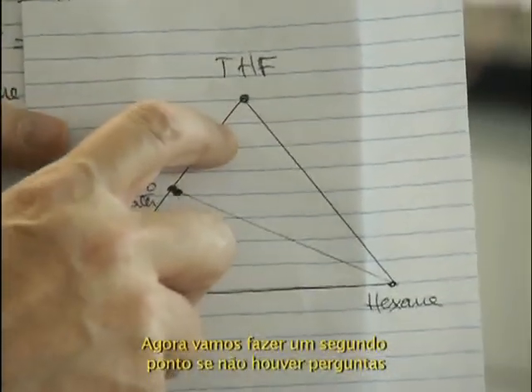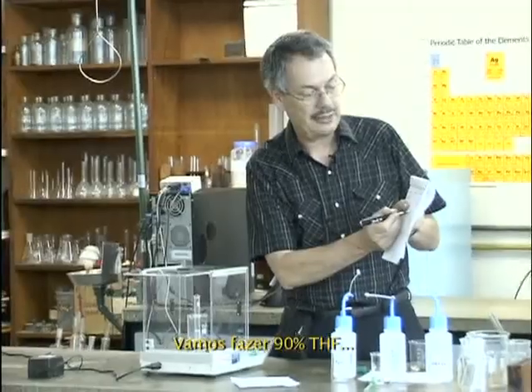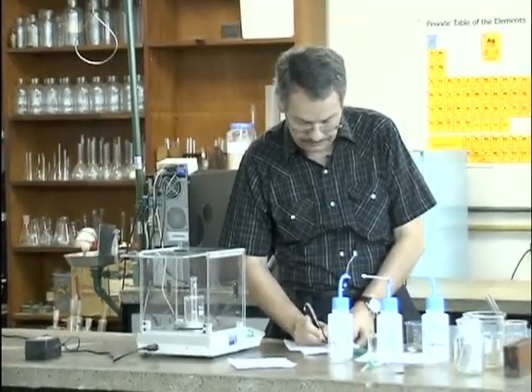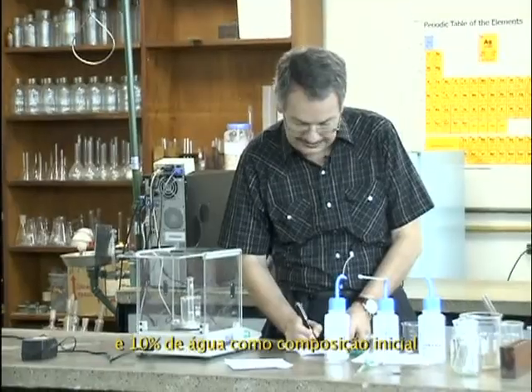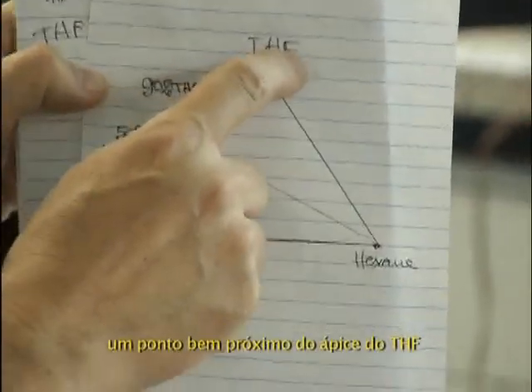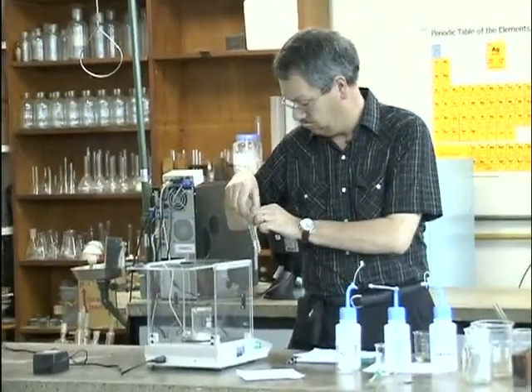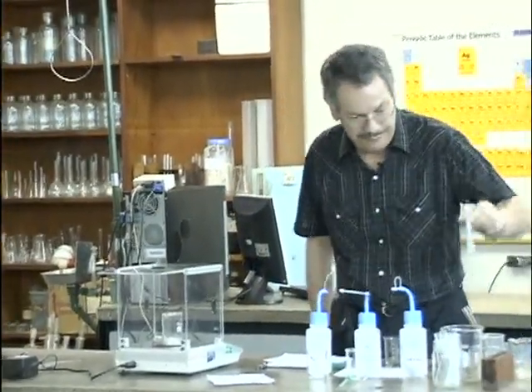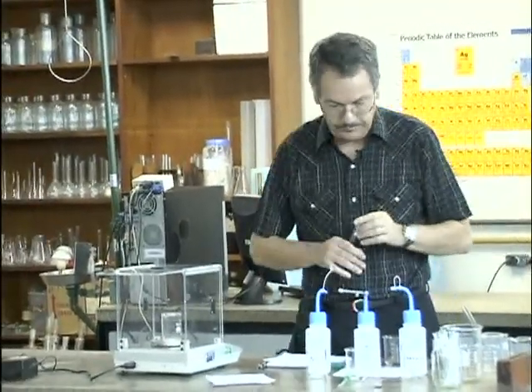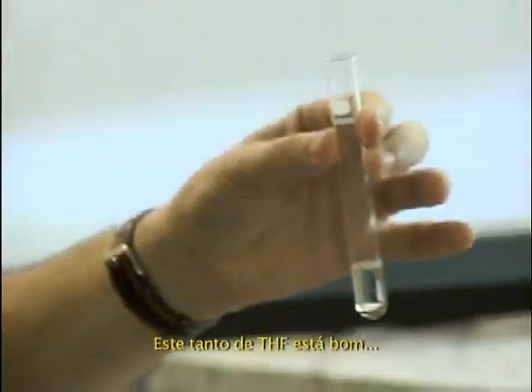if you have no question. And I will go there on 90%. Let's make 90% THF and 10% water as initial composition. A point very close to the THF apex. Let's save this one there, and I take a second tube. This much will do, THF.